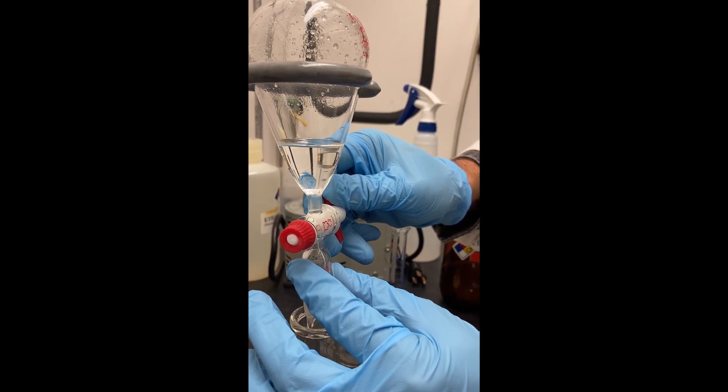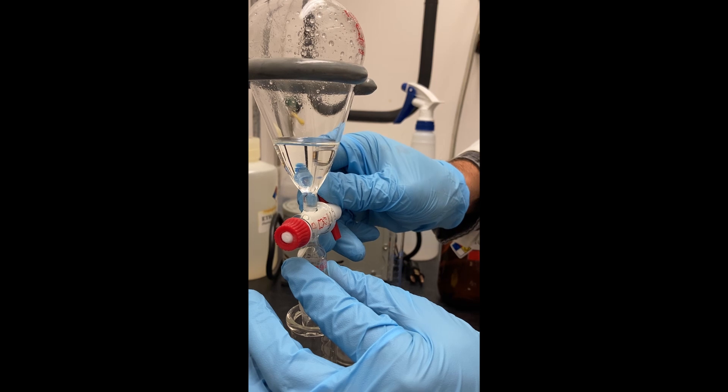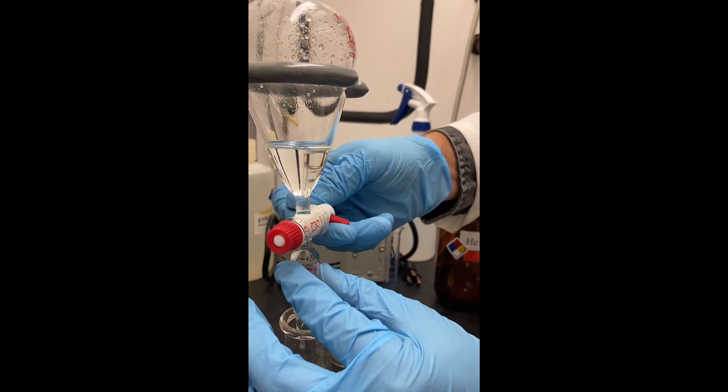You'll want to let some of your organic layer pass through the funnel. This will ensure that your organic layer has less water mixed in.